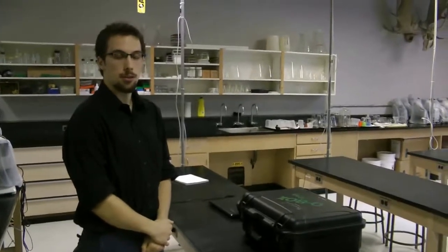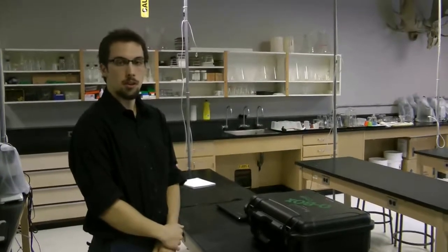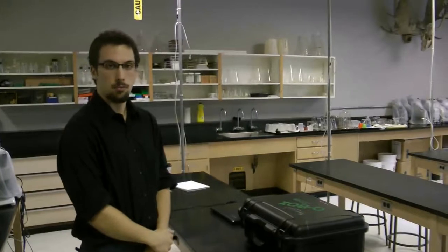Qubit Systems instructional videos for the QBox CO650 Advanced CO2 Analysis Package. My name is Michael, and I'll be walking you through the initial setup and testing of this package.